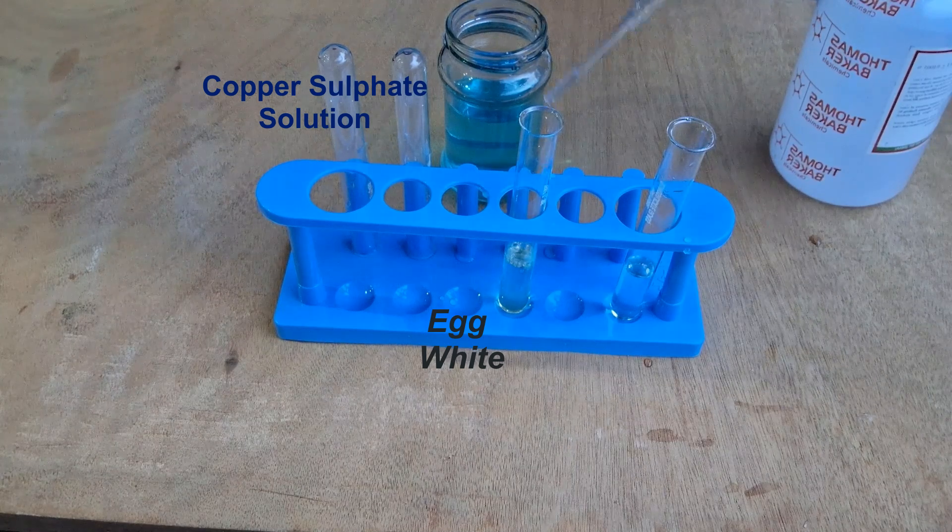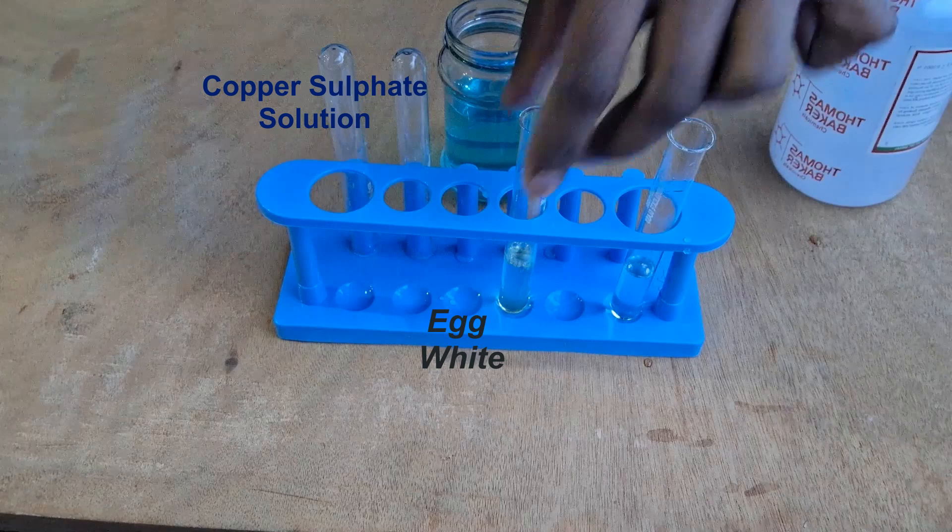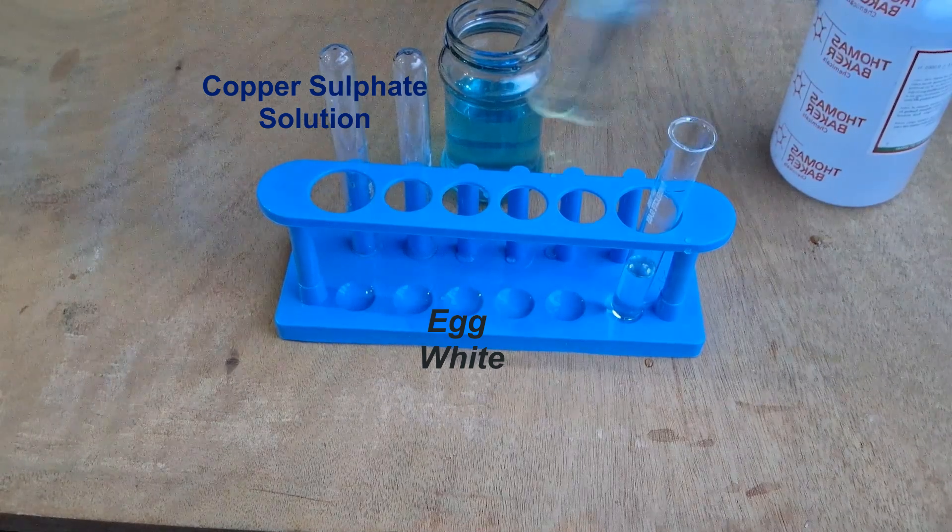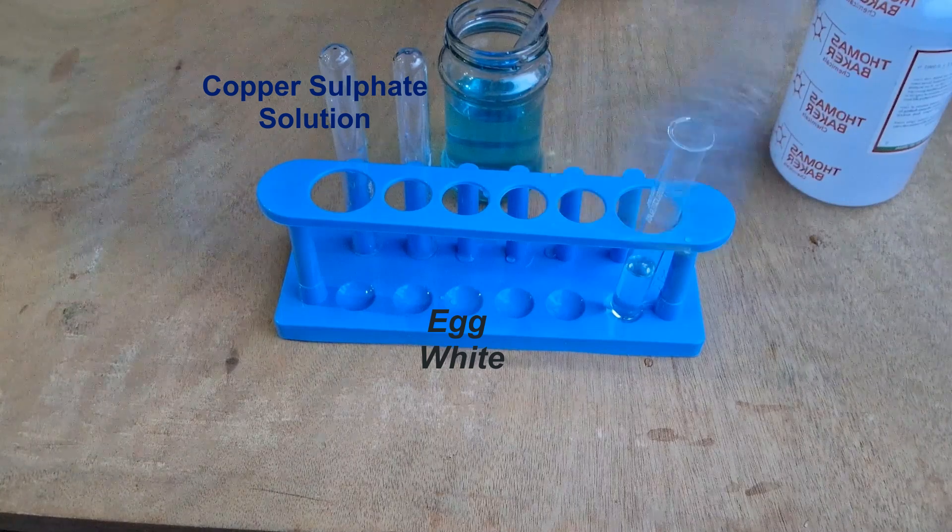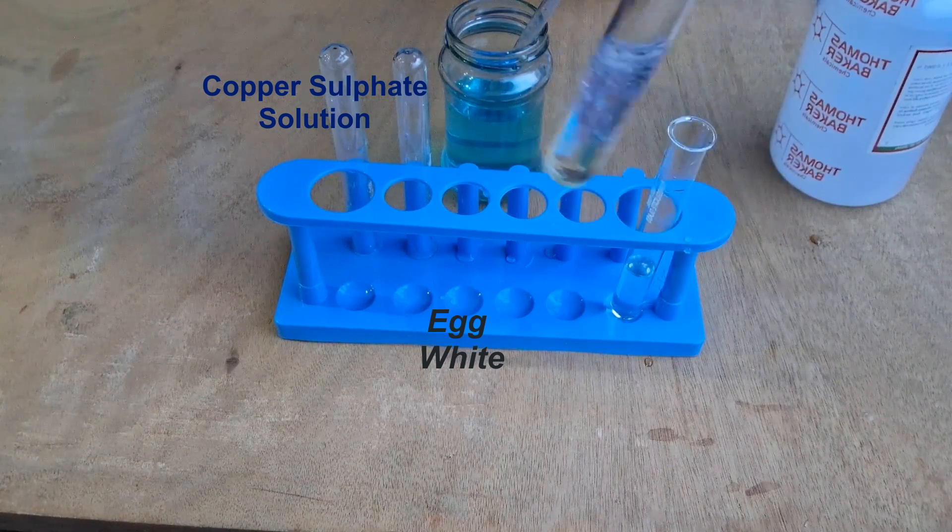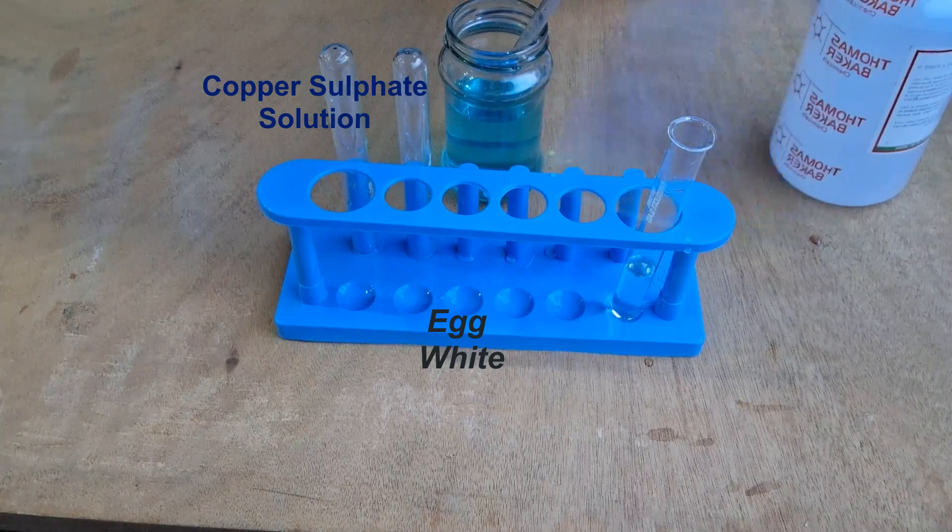Now I'll shake it about. The moment I drop the copper sulfate, I'll immediately shake it vigorously and watch what happens.